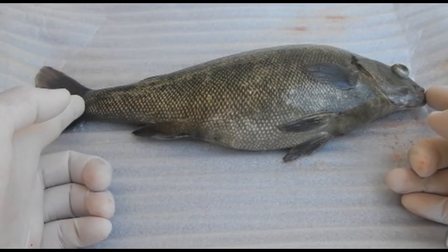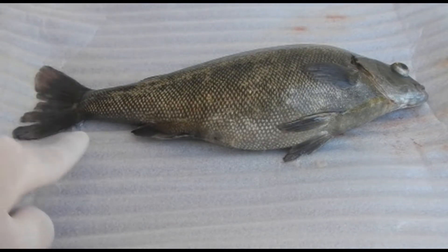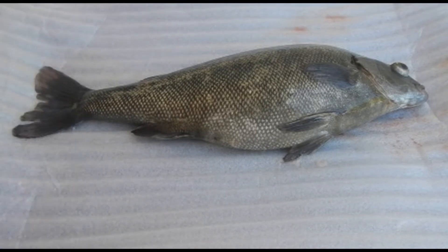There are different people who like to use different measurements for fish depending on what purpose they serve and what species, because tail lengths vary greatly, especially in ornamental fish. That's why we don't always use one defined type of length when describing fish.